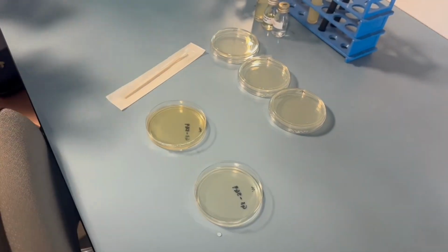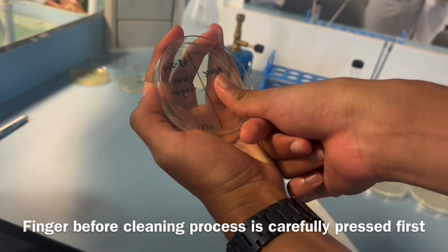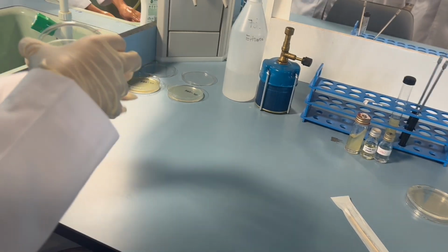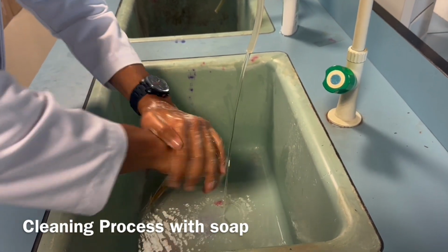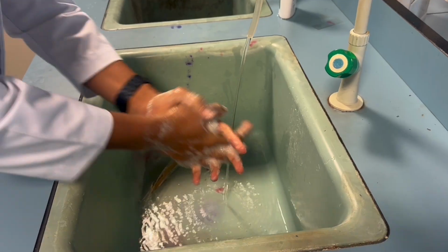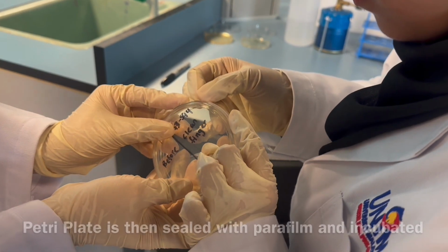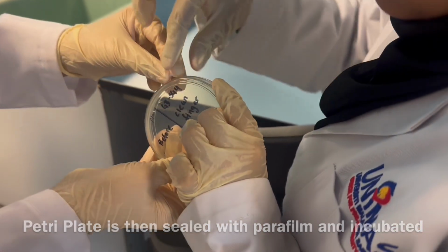So here the Petri plate cap will be opened. And moving on to fingers. So first of all, the finger before the cleaning process is carefully pressed first. And then the cleaning process with soap. Then, the clean finger is carefully pressed on one segment of the other agar. The Petri plate is then sealed with parafilm and incubated.